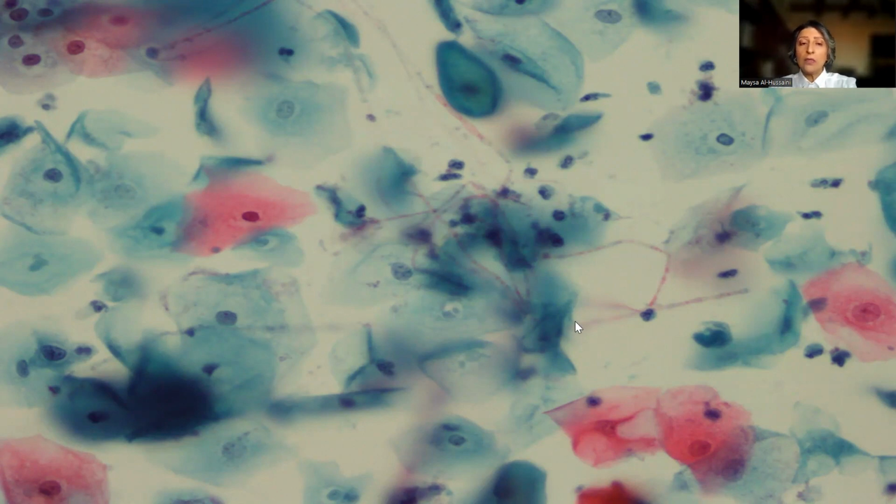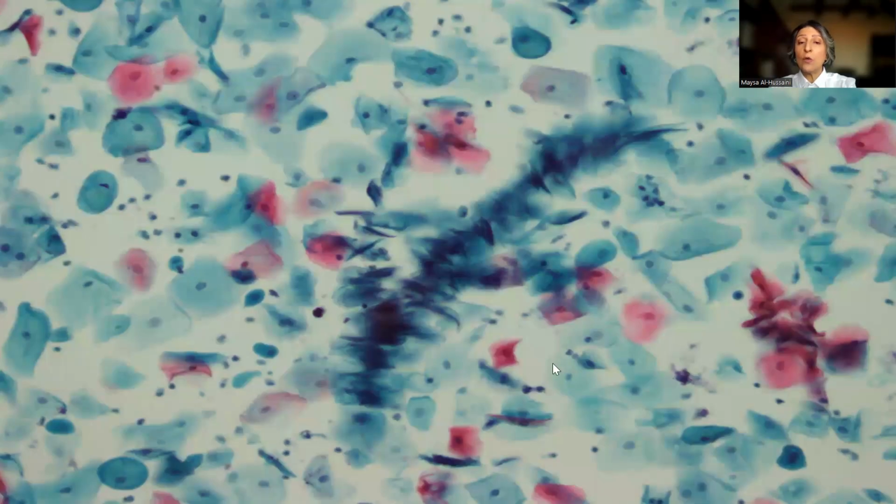Now, an important clue to the presence of Candida is a sign or a feature in which we see the squamous epithelium stacked along one axis. This sign has become known as the Shish kebab sign, and this is similar to an actual shish kebab. The Candida is like the skewer on which the squamous epithelium is stacked.